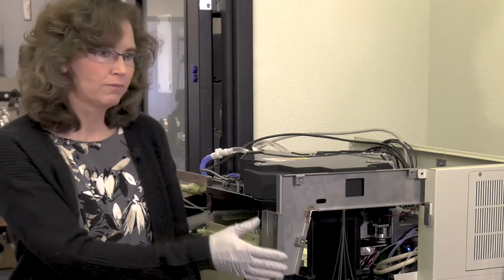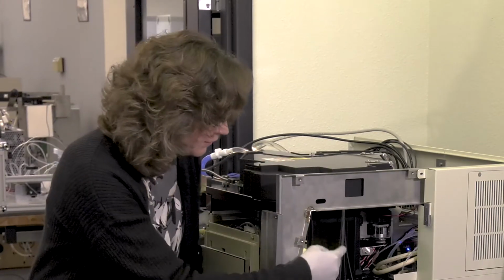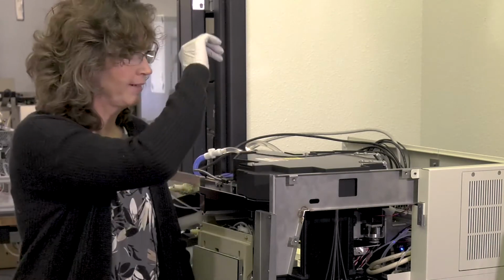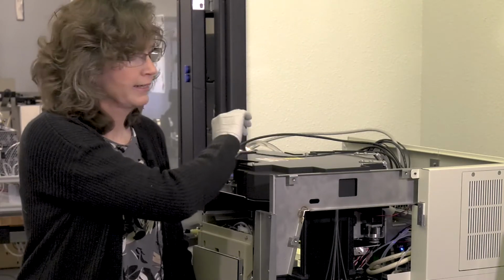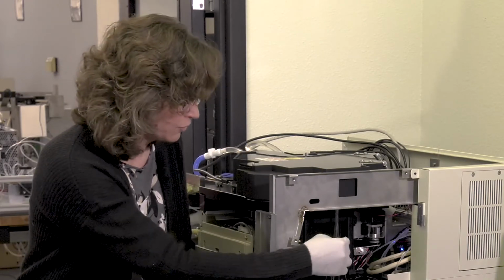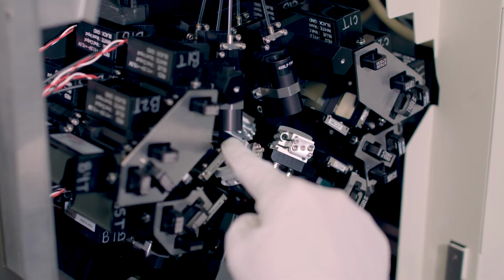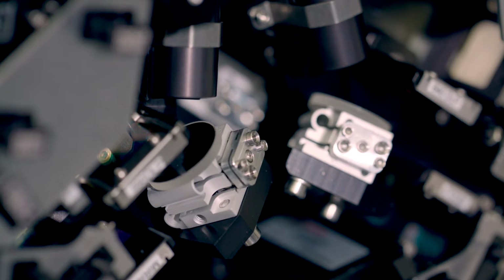The way in which we put the detectors down into this area is to first get the light directed there. There are 5 optical fibers shown here, and each one is assigned to a particular laser on the top plate. In the same way that the sample comes into the optics plate and then exits from it, the detected light, the fluorescent light from the sample, is ejected from the optics plate down into the detection area through these fibers. Each fiber is dedicated to a single laser, and then brought to what we call a detection bank, which has a set of filters where the light is broken into the various wavelength buckets and then detected finally by the PMTs.